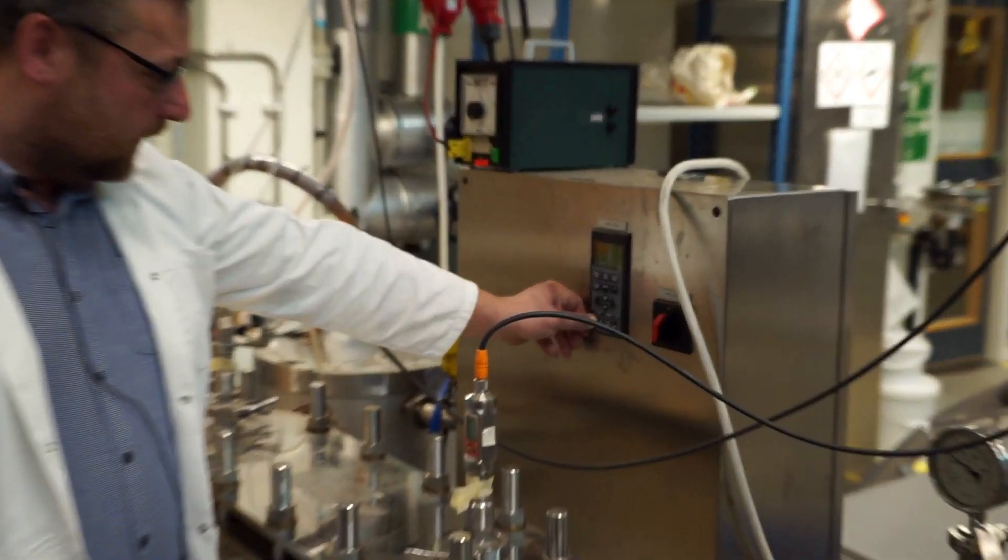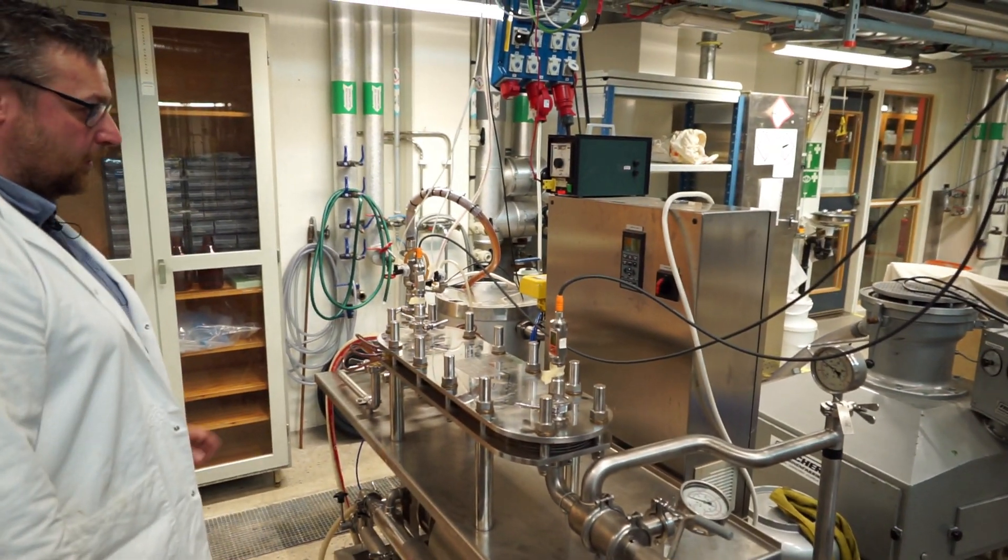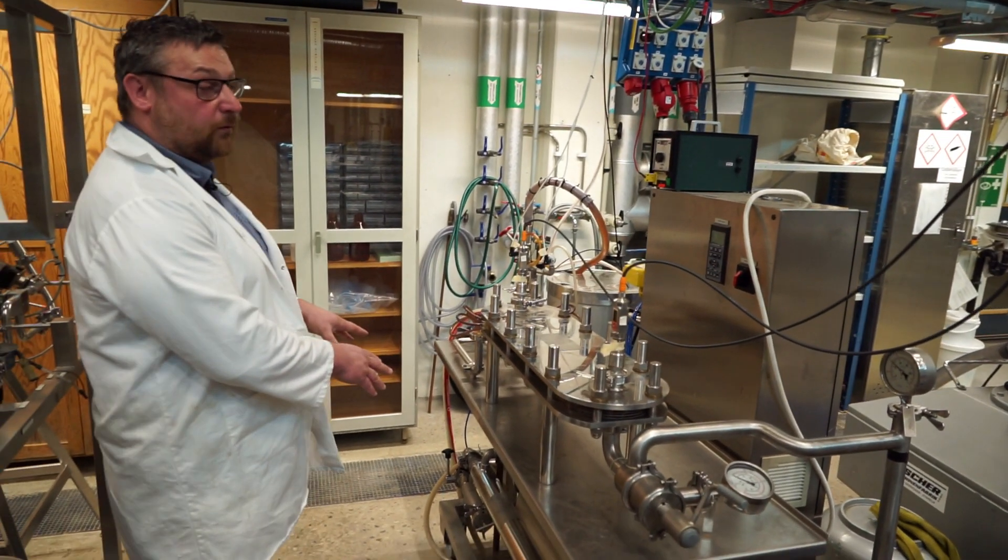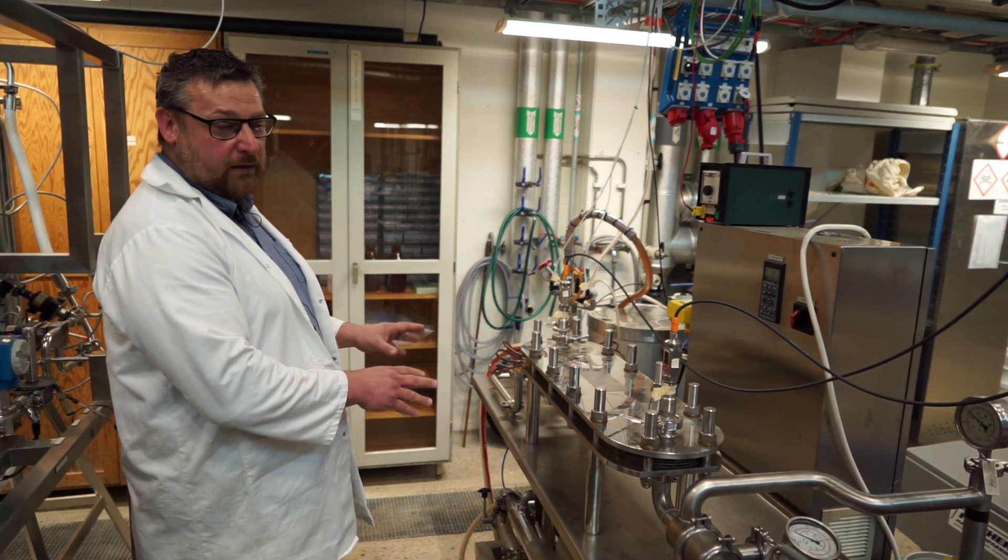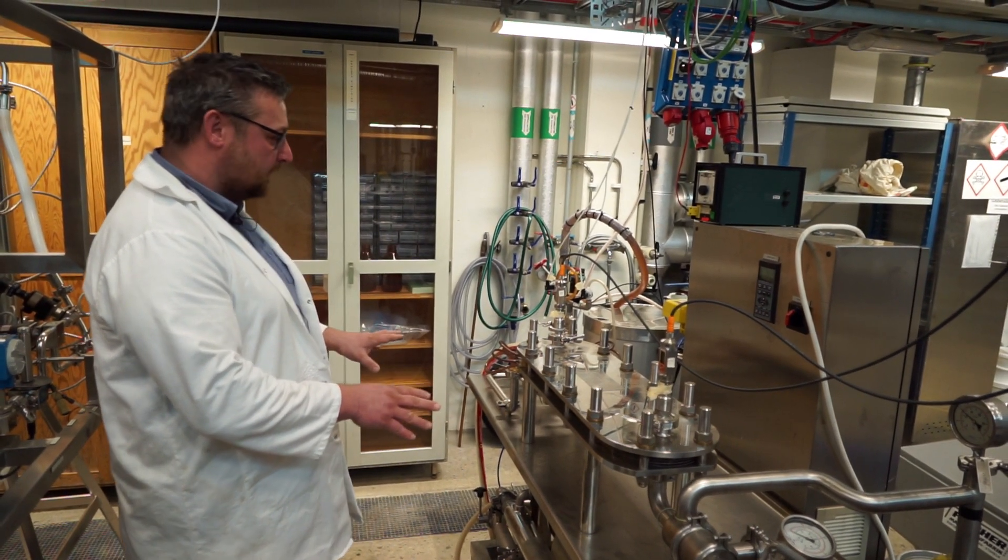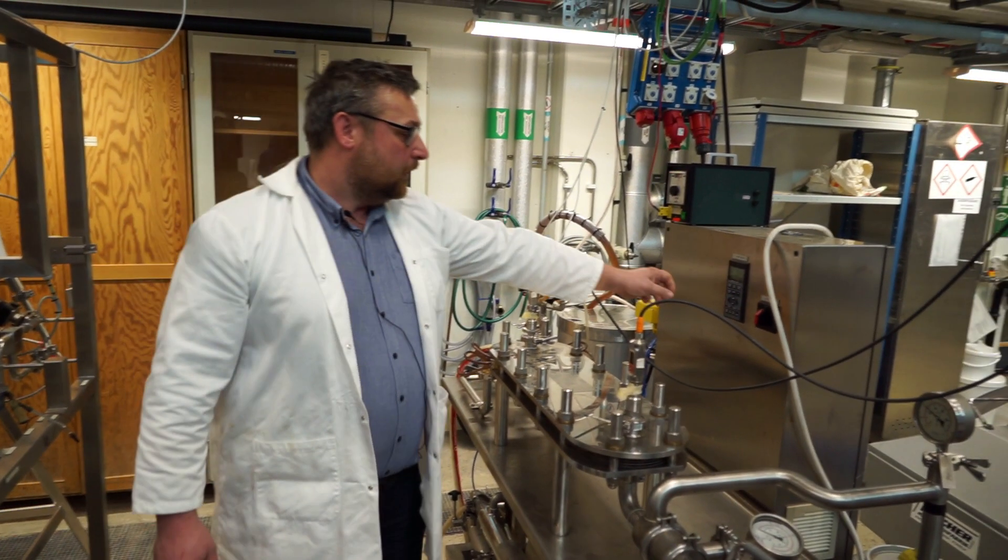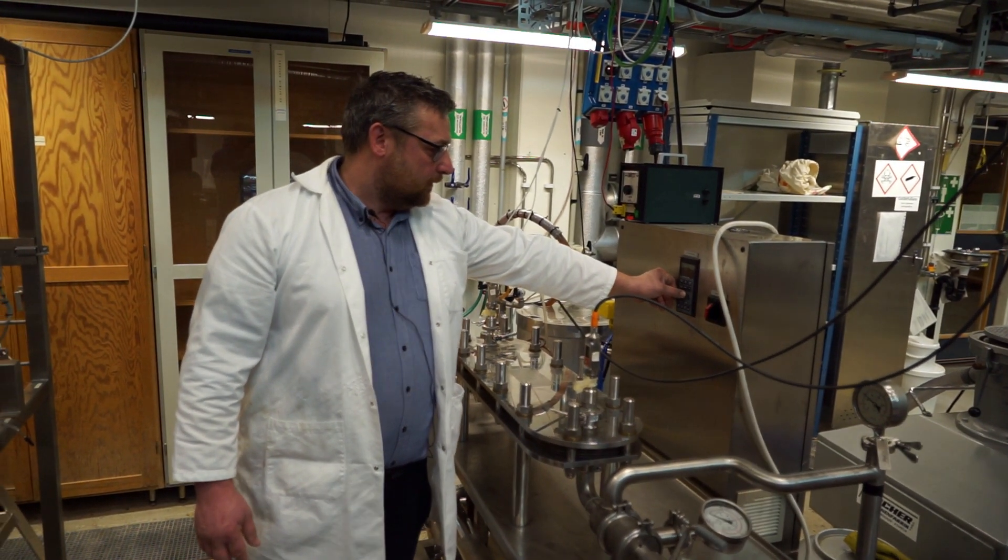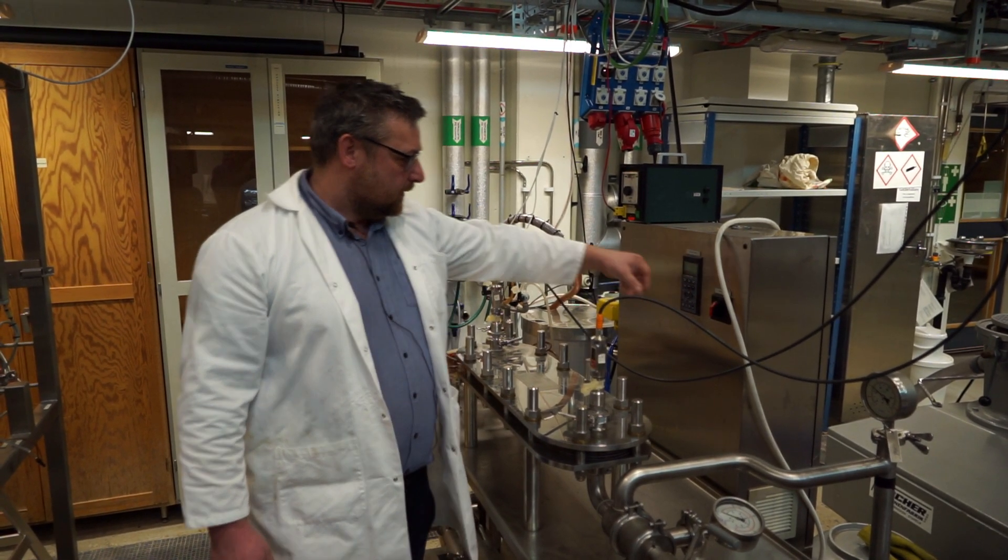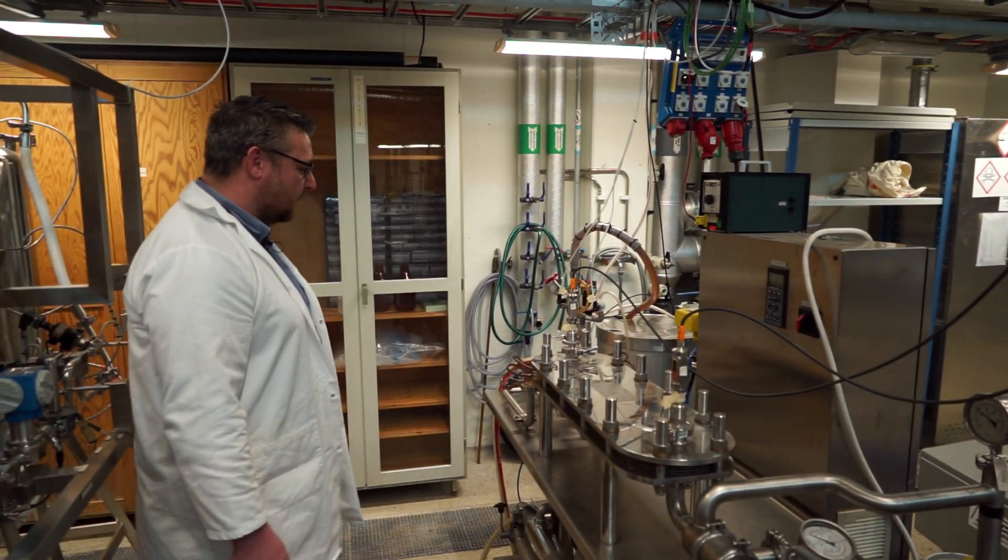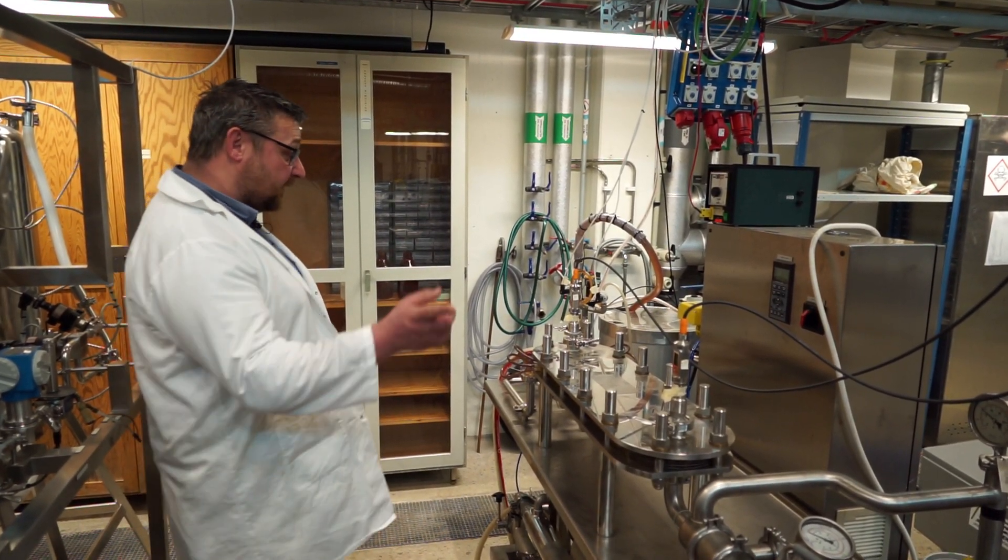So, let's start. Now this is a frequency controlled pump, so I'm starting this at 2 Hz, which is basically just idle speed. It will start pumping really slowly. Then, by increasing the set point, I can go up in flow. We will see over here.